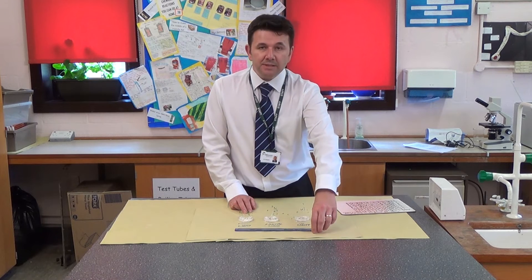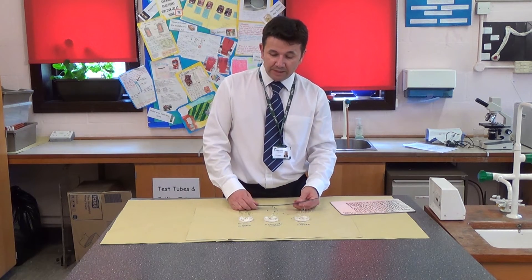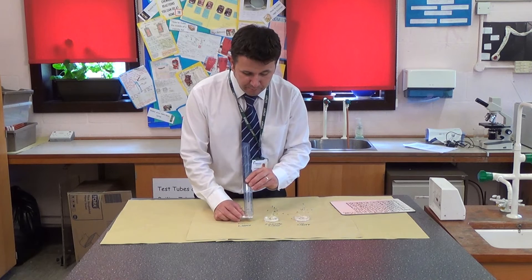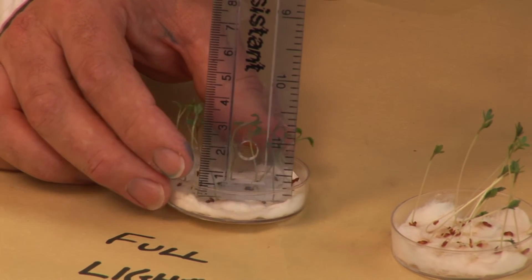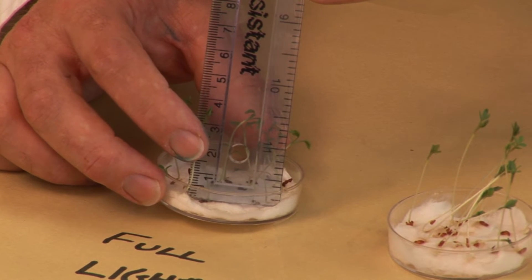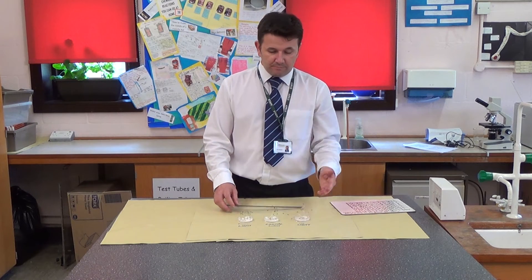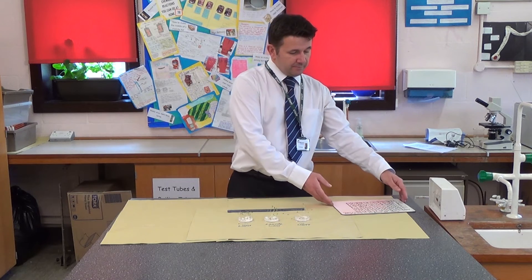I've been measuring every day for seven days, measuring the length of each cress seed. You use a ruler and measure in millimetres from the bottom of the plant to the top. Try to ensure the plant is as straight as possible, then record it in millimetres. It's quite fiddly but you do that for each treatment.